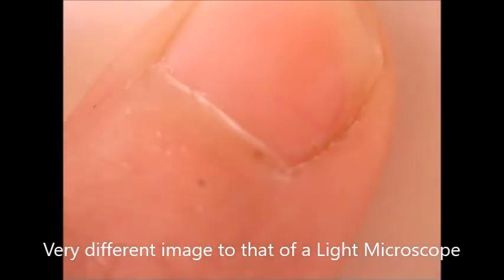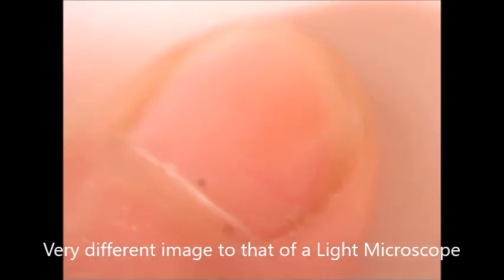Anyway, so that's that. And if you want, you can look at my finger. You can look at your own finger. Look at that. You can see how dry my cuticles are. It's not nice to look at your skin close up. Ugh. You can see what's really going on. And you can look at your thumbprint, your fingerprint. Ooh, there we go. You can really see the skin fingerprint there. If you've done Year 8 STEM, you might know about how to identify that fingerprint. But anyway, there it is.